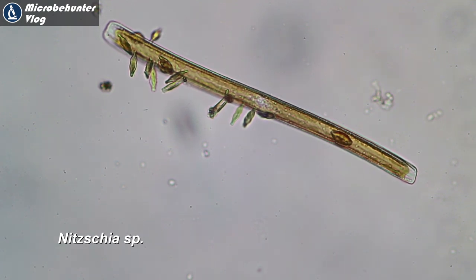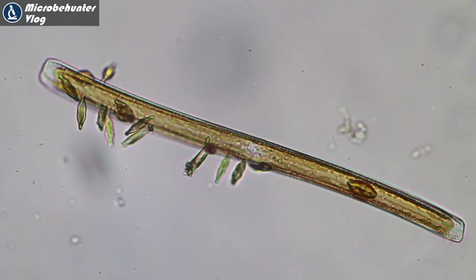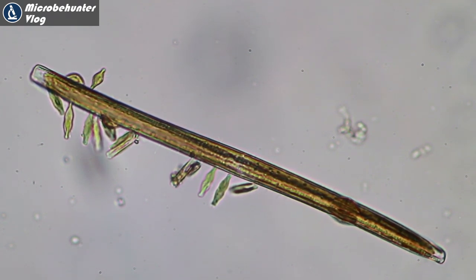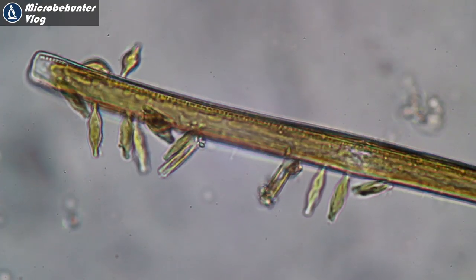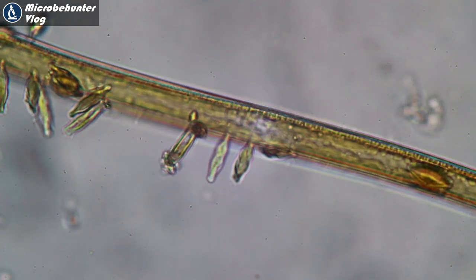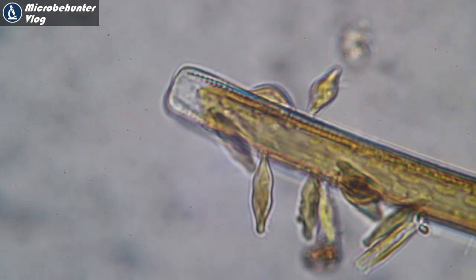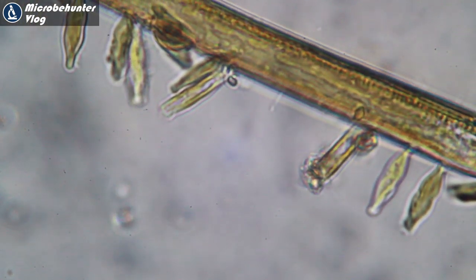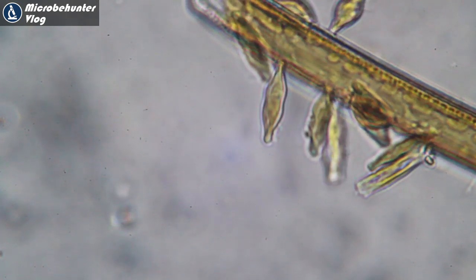Now look at this one — this diatom is quite interesting because it has other smaller diatoms growing on it. They are significantly smaller but they are also diatoms, and they can attach to a surface. In this case they found a larger diatom to be carried along. Maybe that's a good strategy to explore new areas — simply attaching to another moving diatom. The smaller ones are also brownish-green, so they also have a chloroplast.